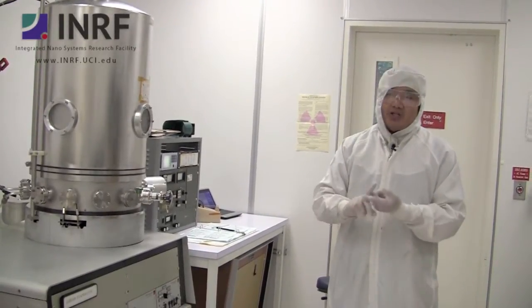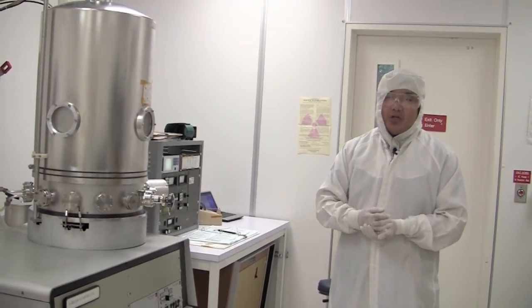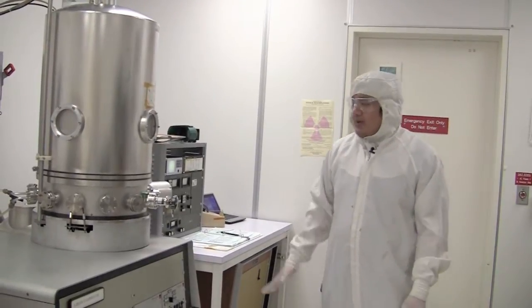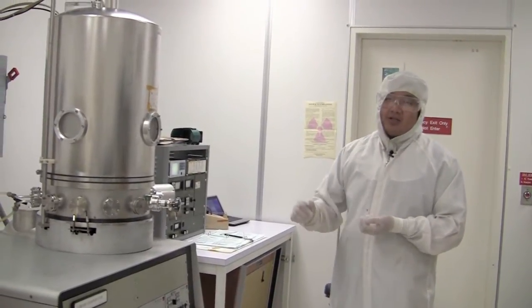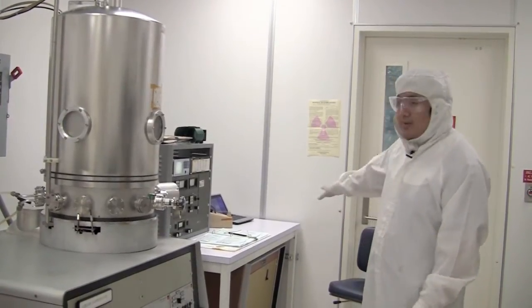So before you can use the machine, you need to be trained and qualified and once you get those two things accomplished, you'll get an account to log in. So when you come to the system, you want to make sure nobody else is using it, the system is not down, and then if those are all fine, then you come in and log in.